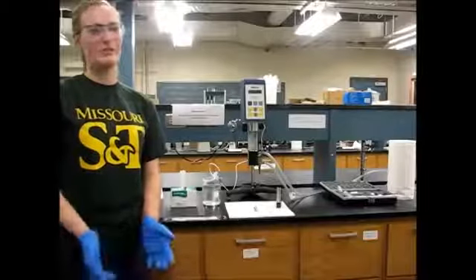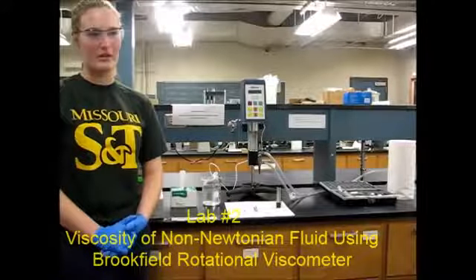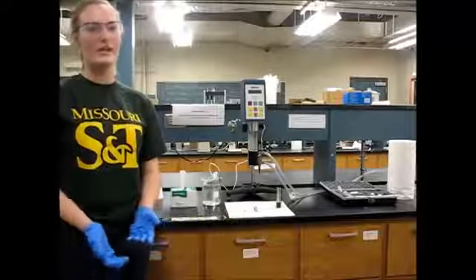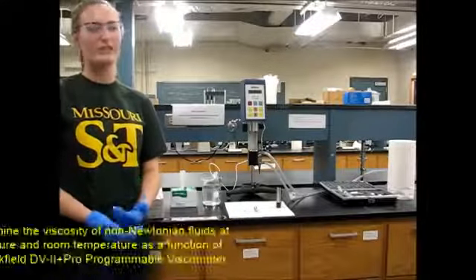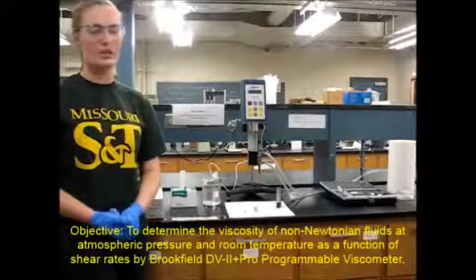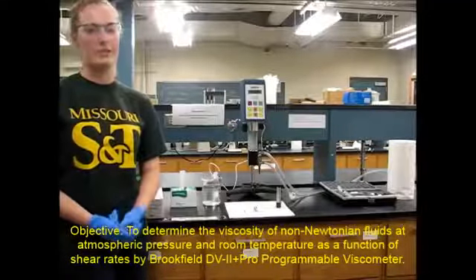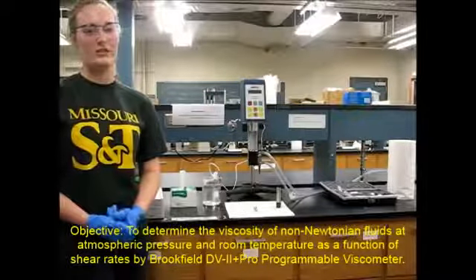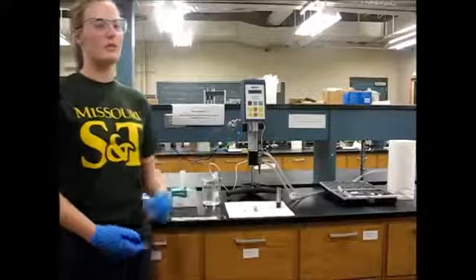Welcome to Lab 2, Viscosity of Non-Newtonian Fluid using the Brookfield Rotational Viscometer. As we know, fluid viscosity is defined as the internal resistance to fluid flow. The objective of Lab 2 is to determine the viscosity of a non-Newtonian fluid at atmospheric pressure and room temperature as a function of shear rates using the Brookfield programmable viscometer.